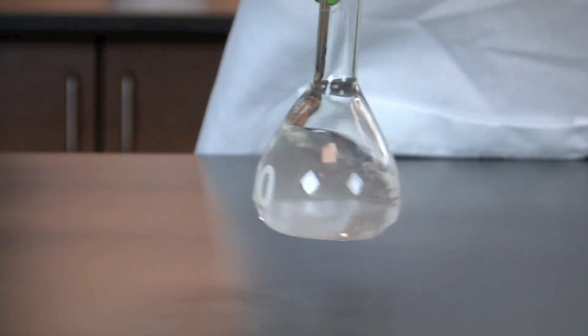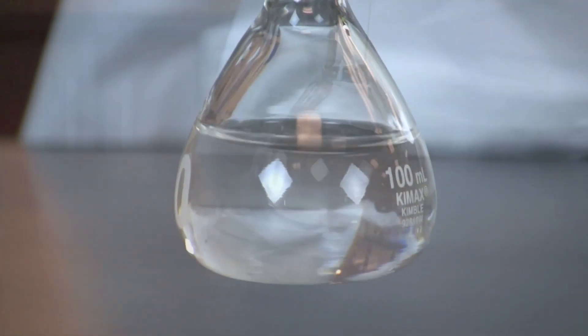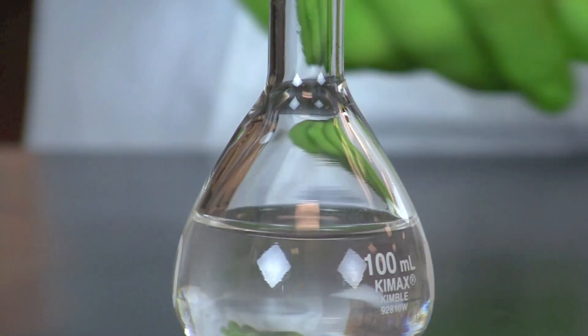Swirl to dissolve the sodium chloride crystals. Continue swirling until the solution is clear, indicating that all of the sodium chloride crystals have dissolved.